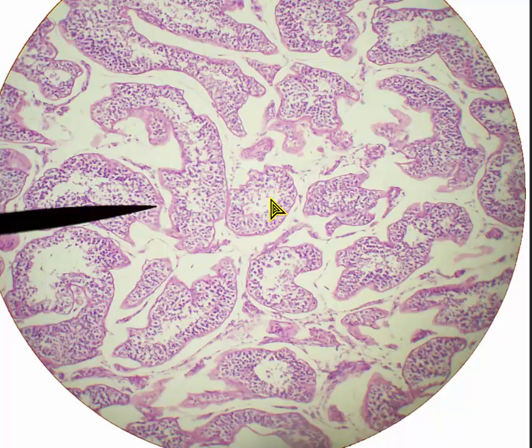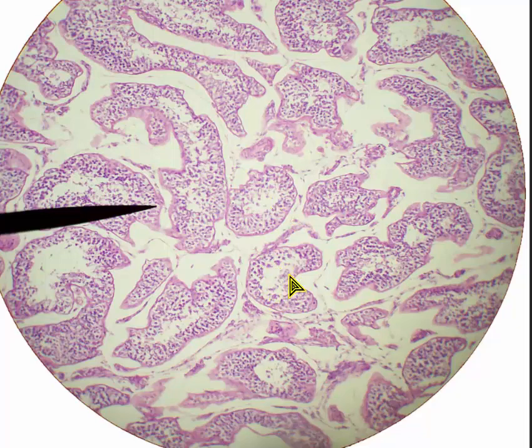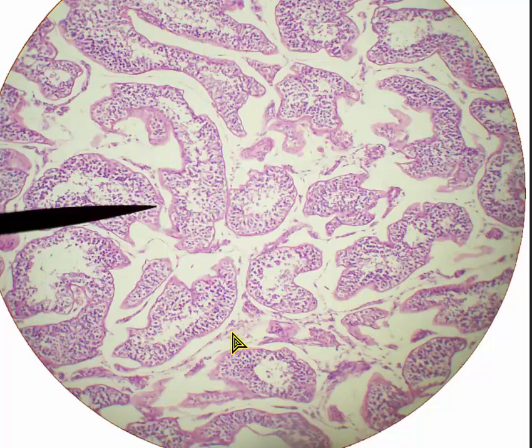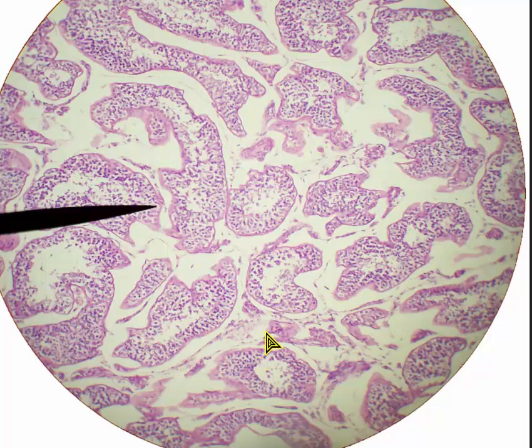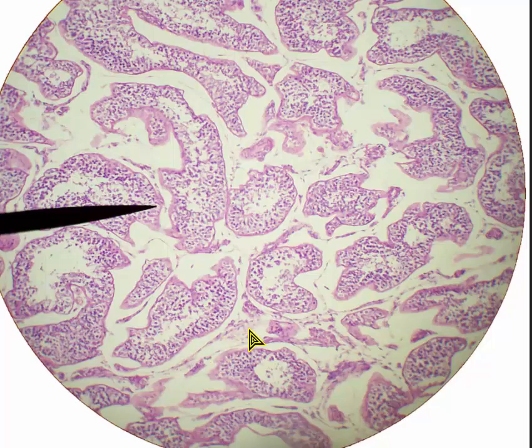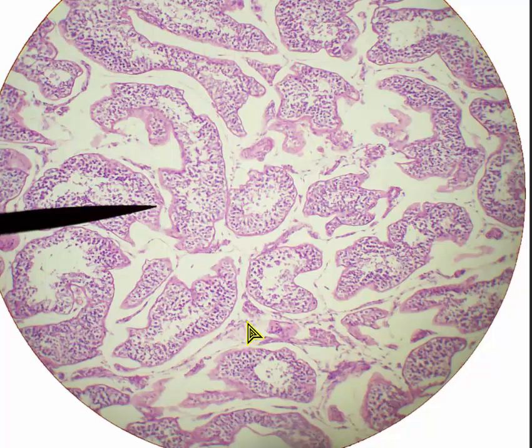This is 100 times magnification. We have a seminiferous tubule here and here. Now we're starting to see the interstitial cells, or Leydig cells, which are between the tubules. There are different types of cells in this space, but the major type are called Leydig cells, and their function is to make testosterone.